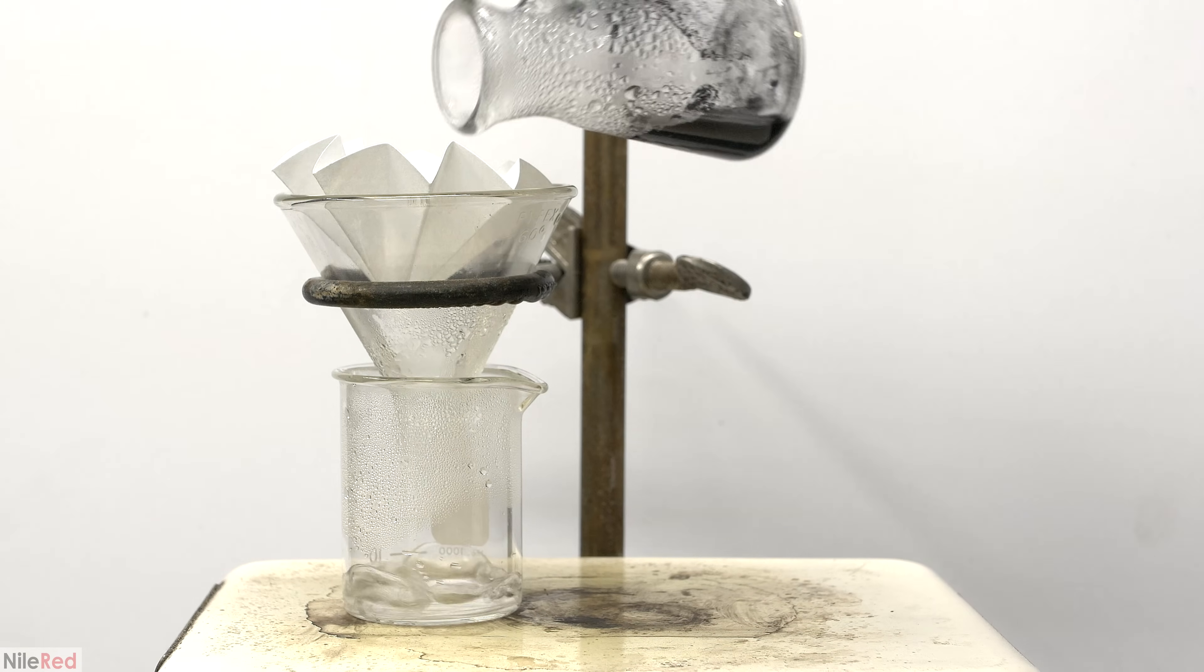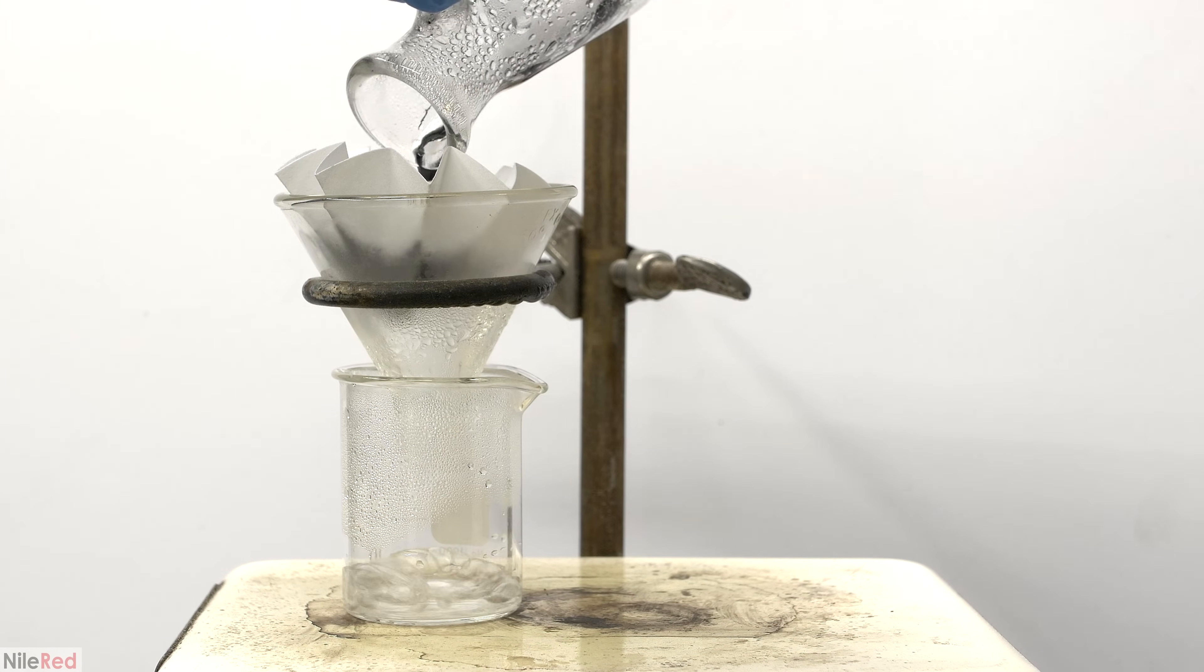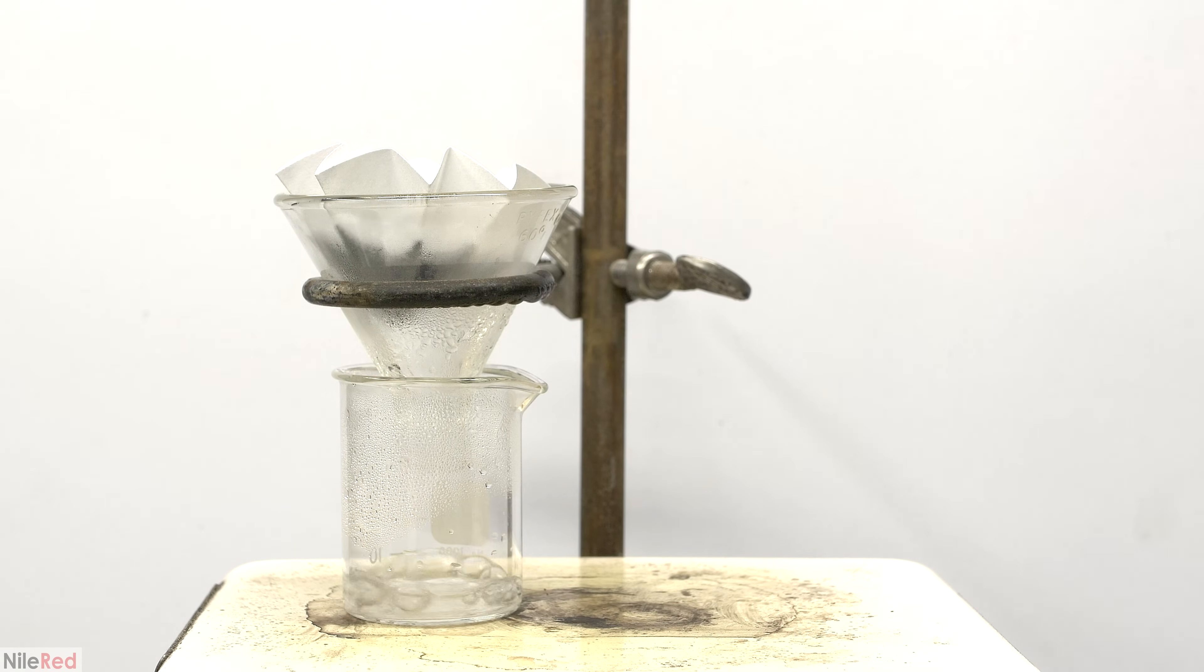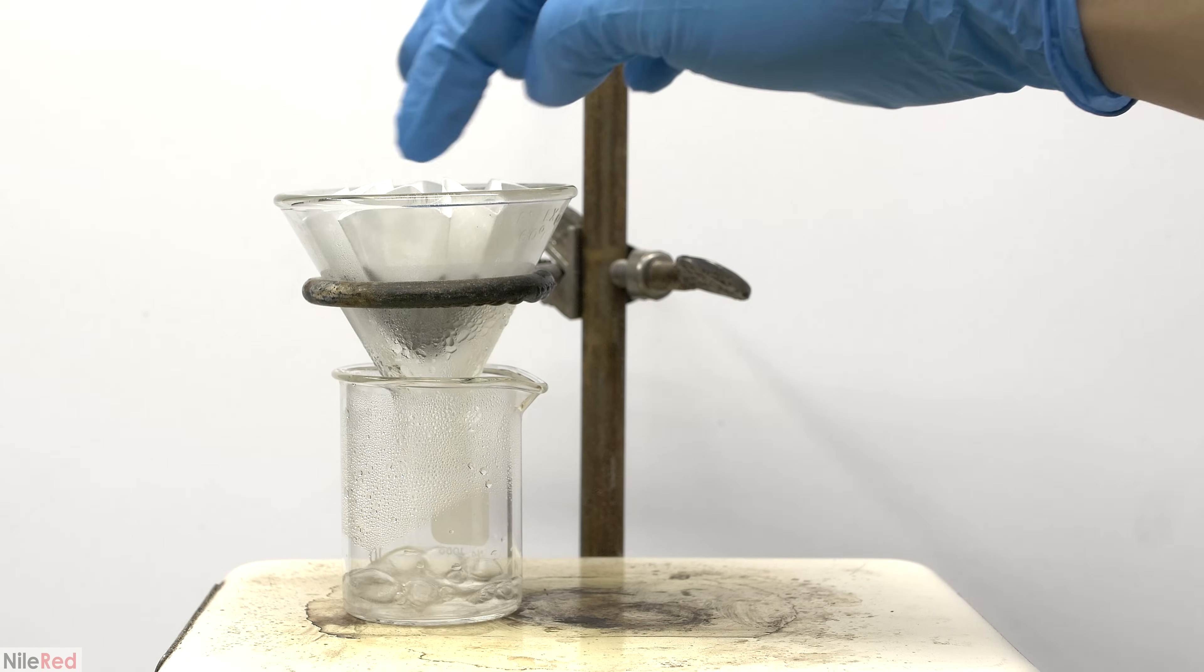I let the solution boil for about 30 seconds and then filtered it off. It might be hard to see, but the liquid coming through is nearly colorless, so it's looking good so far.